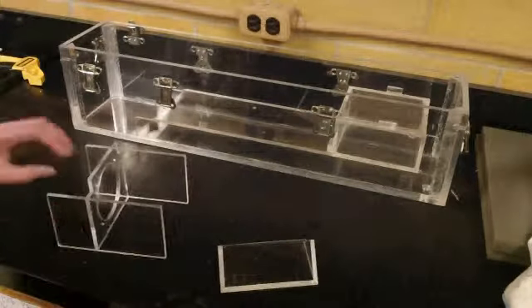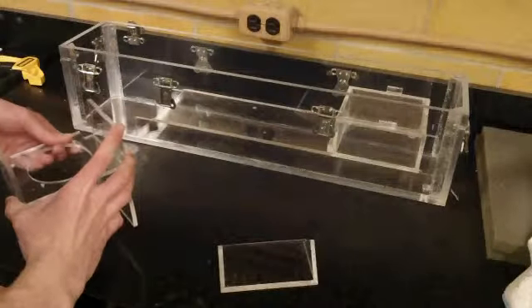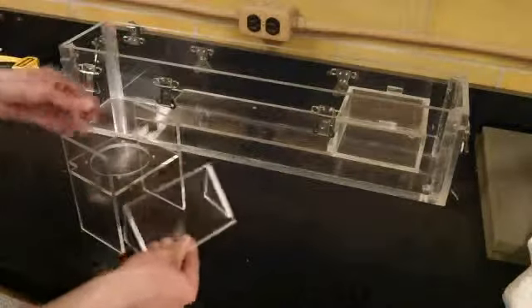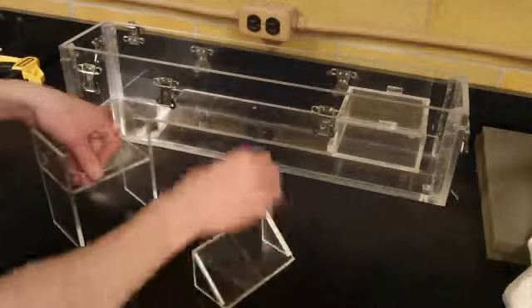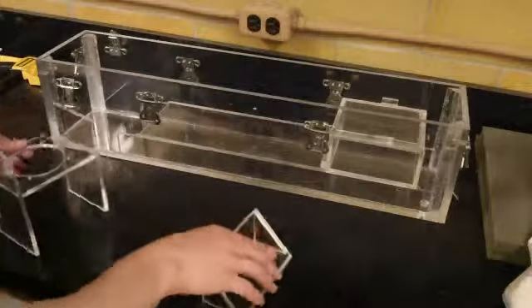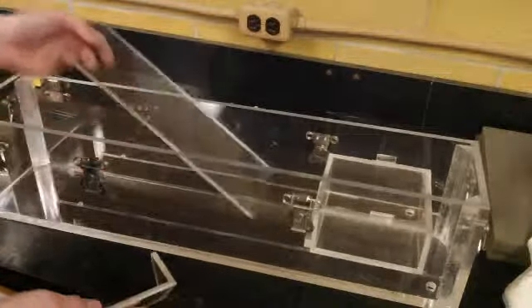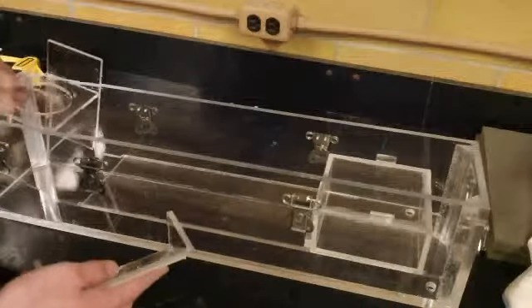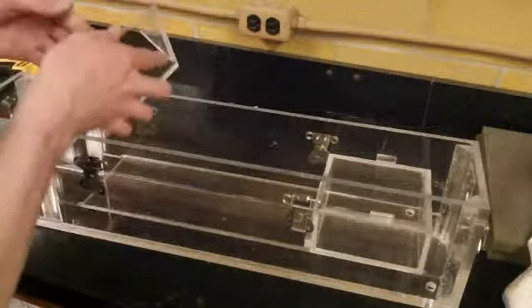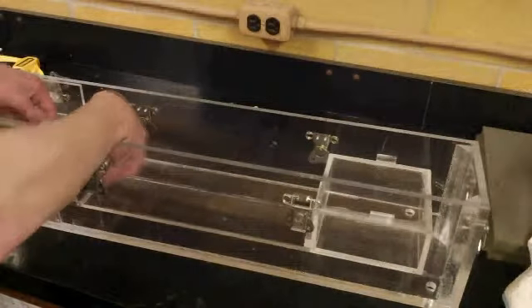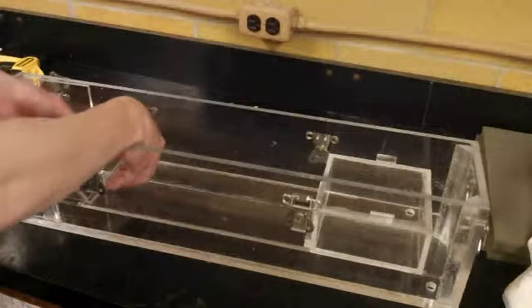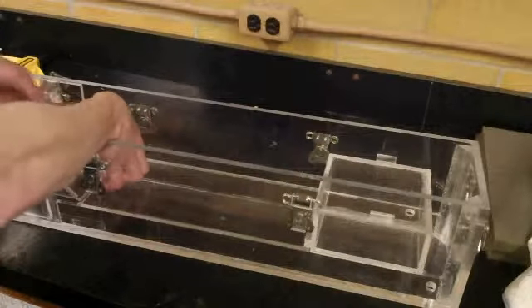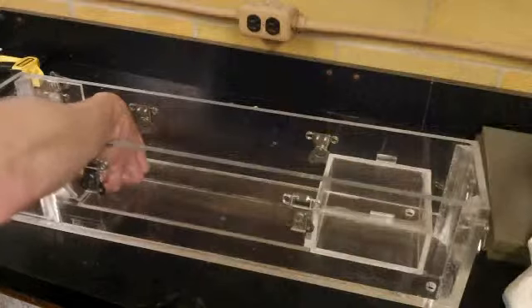It's been about 15 minutes and the cement here has dried, so we can go on and proceed with the next step, which would be to add this little hood to our motor housing. And so to do this, we'll just take one of our completed chambers with the shelving in place. We'll slide our motor housing in and then add this hood so it's just off the bottom, allowing enough room to slide the shelving unit in and out. And from there, we'll go ahead and add a little bit of the cement.